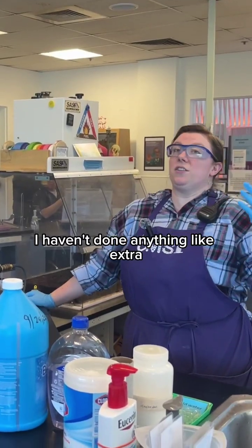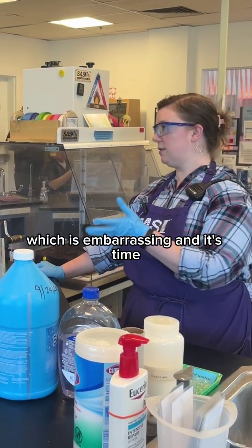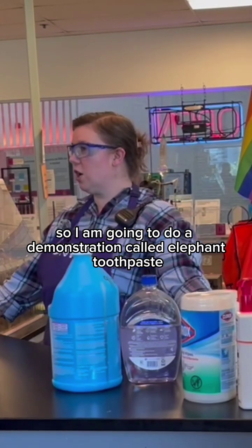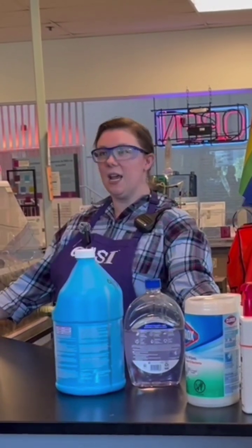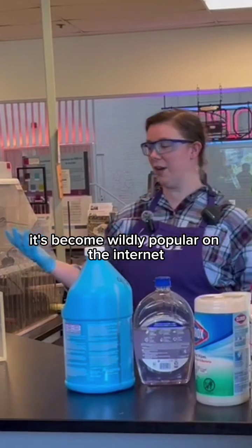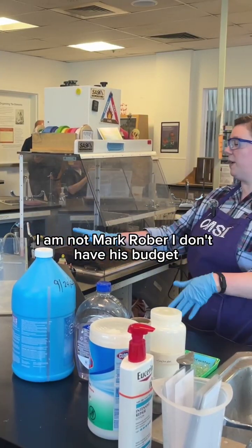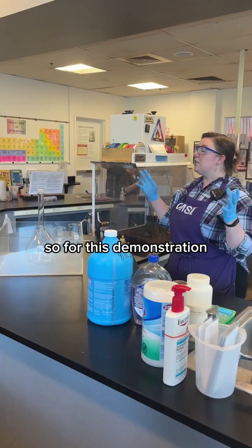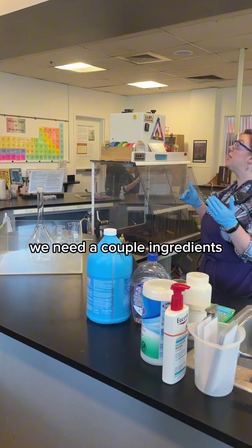I haven't done anything extra exciting in about an hour, which is embarrassing, and it's time. So I am going to do a demonstration called elephant toothpaste. This has become wildly popular on the internet. I am not Mark Rober, I don't have his budget, but we are still going to do cool things. So for this demonstration, we need a couple ingredients.